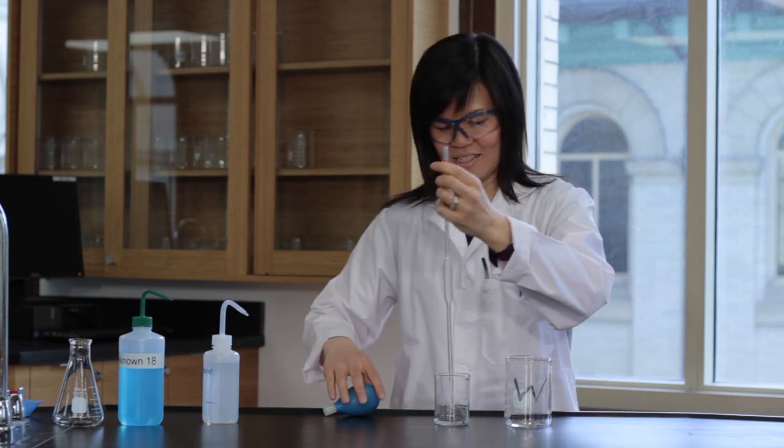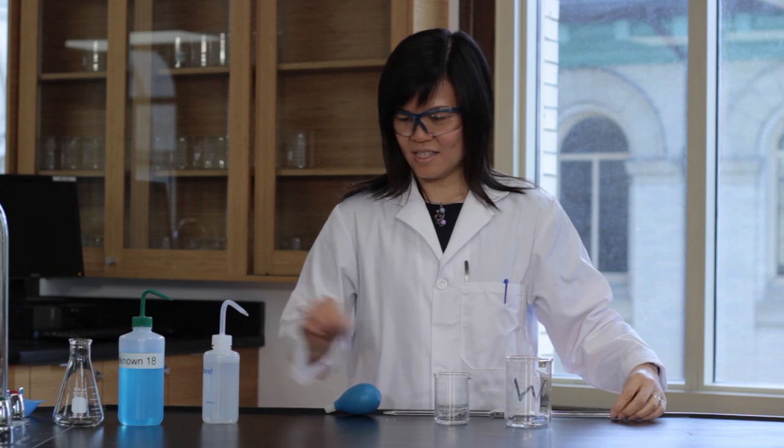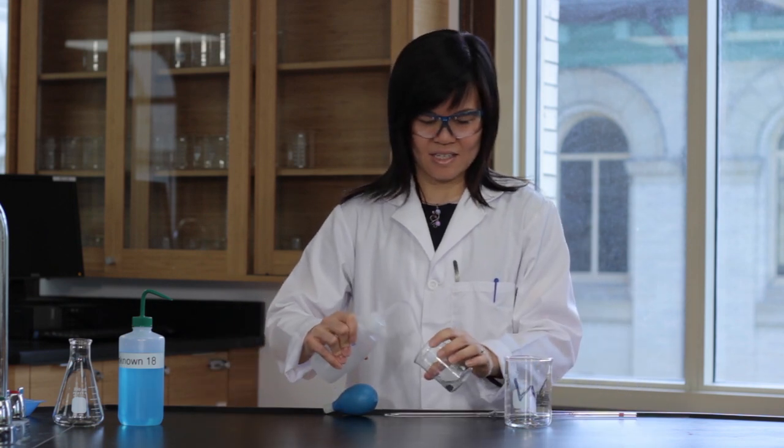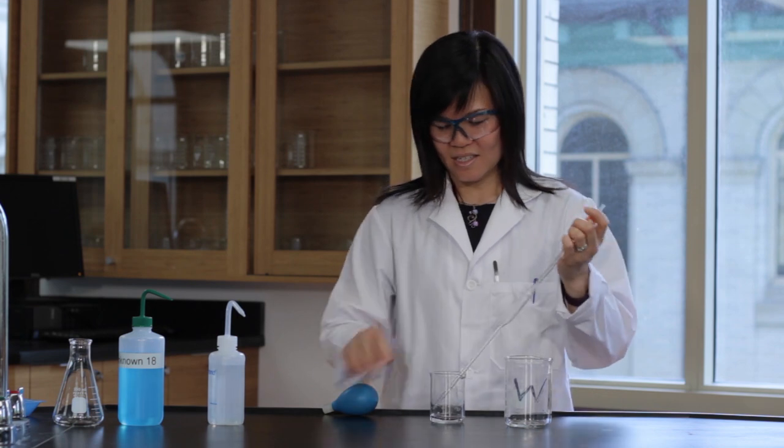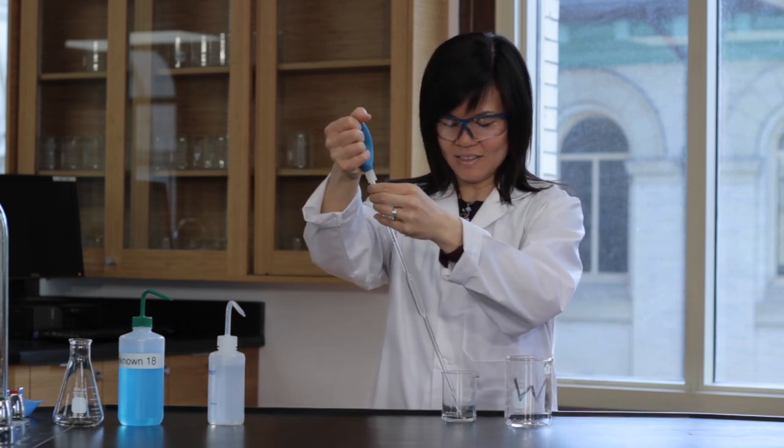Drain the tip into a waste beaker. Rinse the pipette again with water.